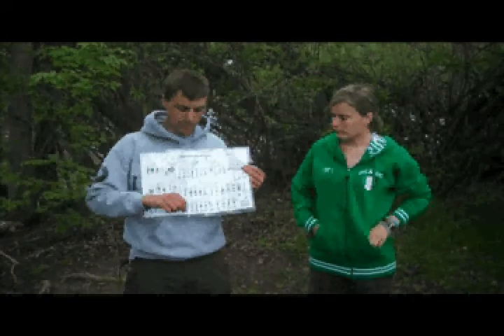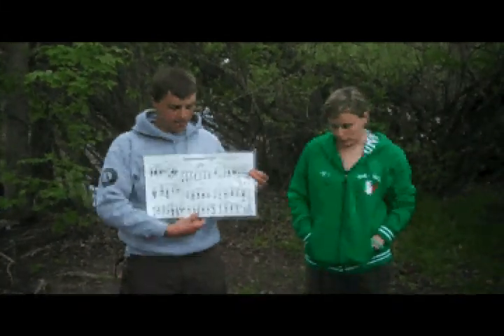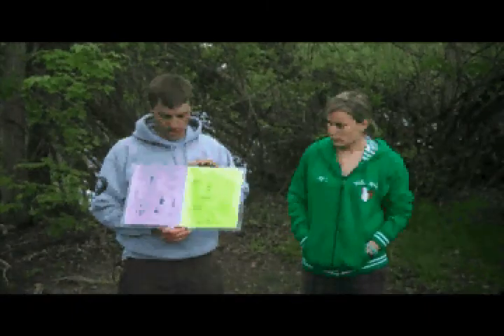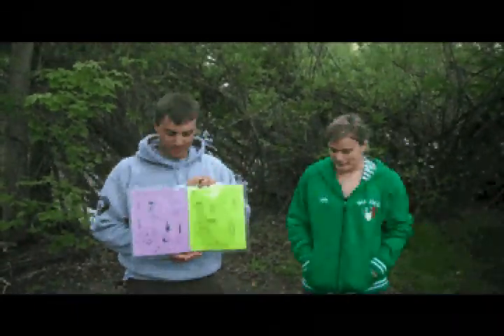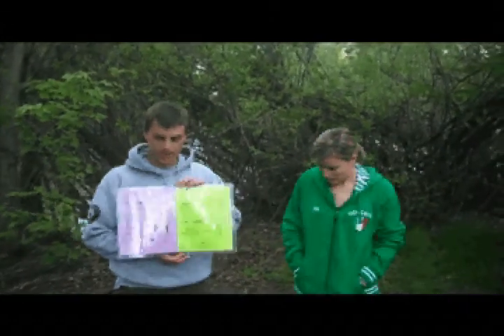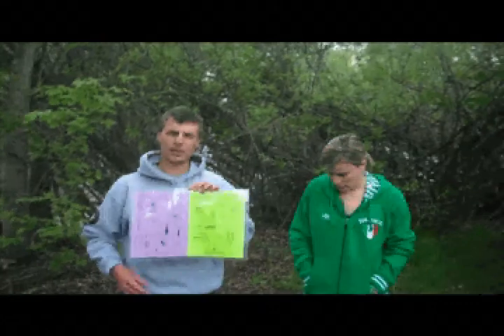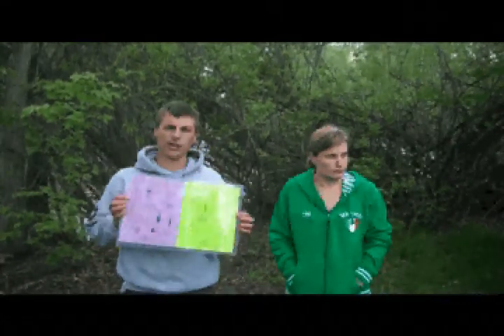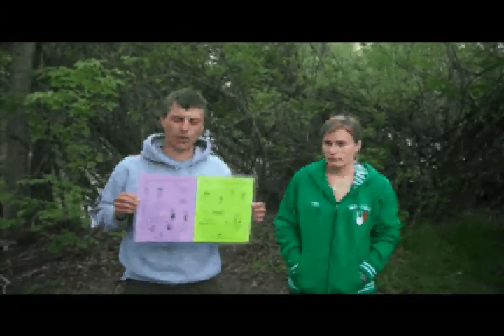And we're going to do some sorting into these ice cube trays that have been filled with river water. And on the back side of this, there's an illustration that talks about the level of pollution tolerance. So if an organism is tolerant of water pollution, it will be able to withstand more water pollution. So we're looking for things that are intolerant of water pollution to indicate higher water quality.